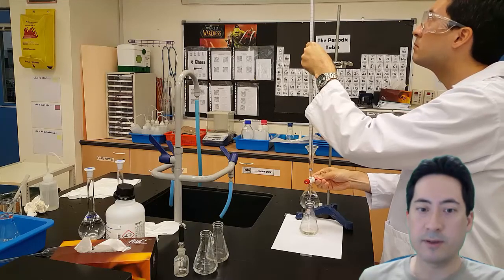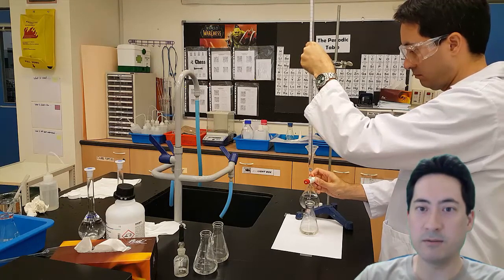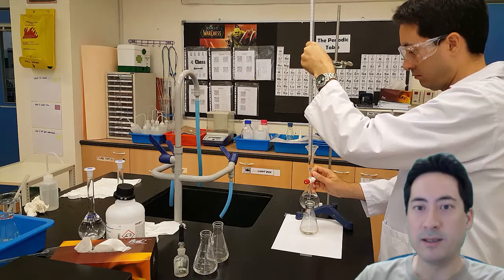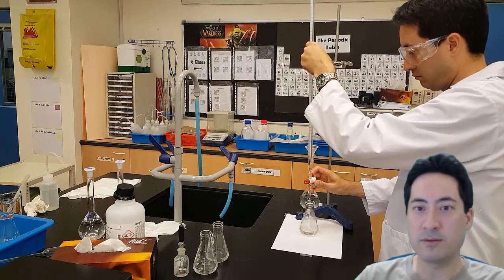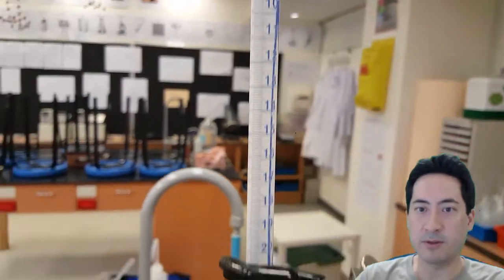And I'm ready to do my rough estimate. So the rough estimate is just a way to save time so that you can get a rough idea of where you are. So you can do it really quickly the next time, which is the real first trial. And then go down to really close, half a mil or a mil of where you know the answer should be. And then you can go down to the drop by drop.